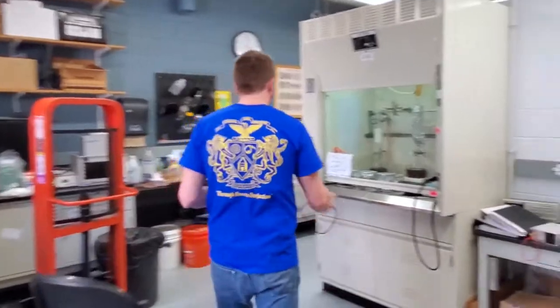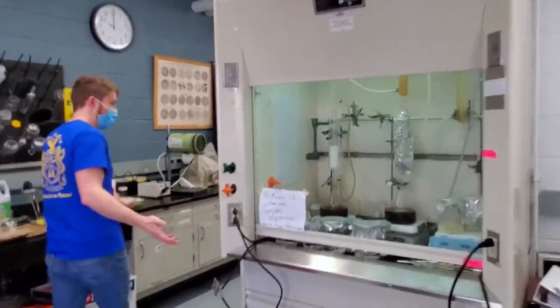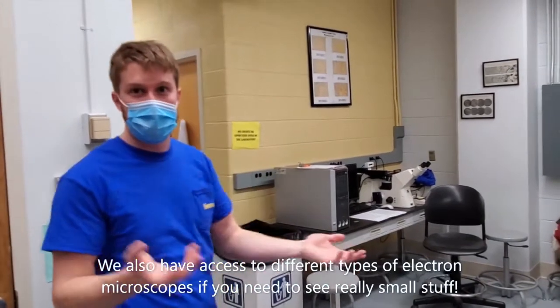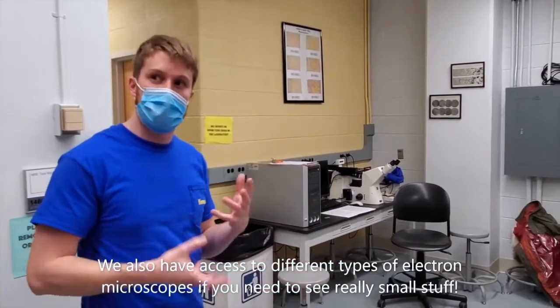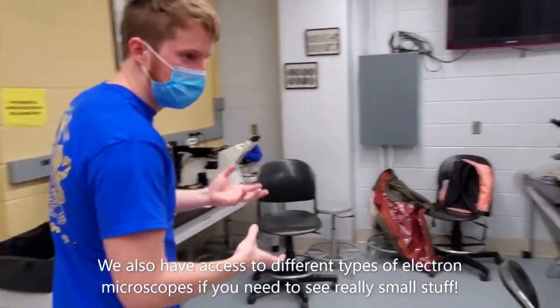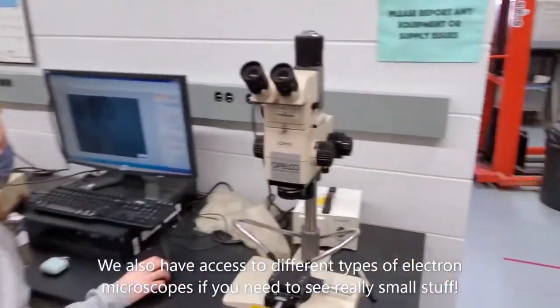Also in this room, we have all of our microscopes. This is for different types of optical microscopy. This gives you insight into the grain structure and microstructure of the material that you're working with, which has a lot of impacts on its mechanical properties. So understanding the microstructure of the material is key to understanding how the material will behave in different situations.